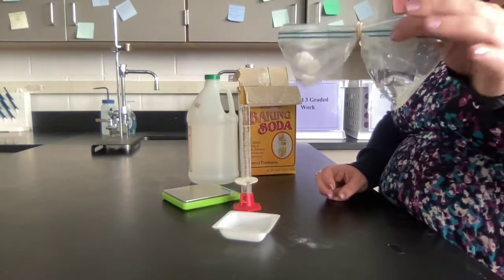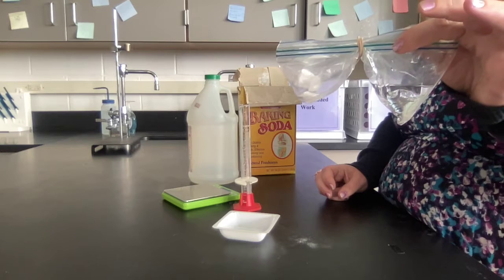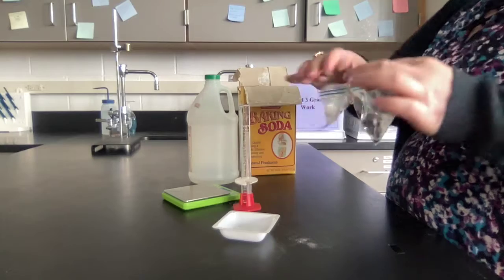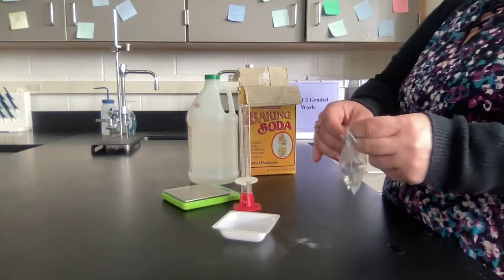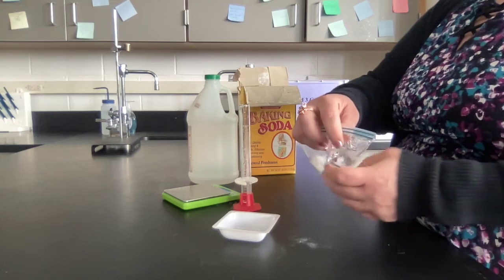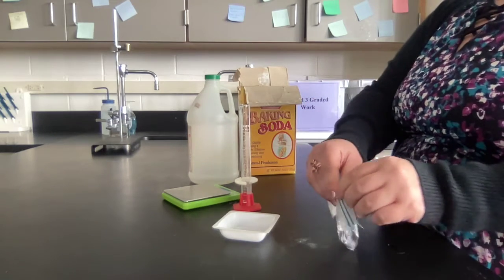Okay, so you can see they are not reacting yet. They're in their own little compartments. So the next thing I'm going to do is take the rubber band off. And when I do that, I'm going to close the middle, make sure the whole thing is sealed.